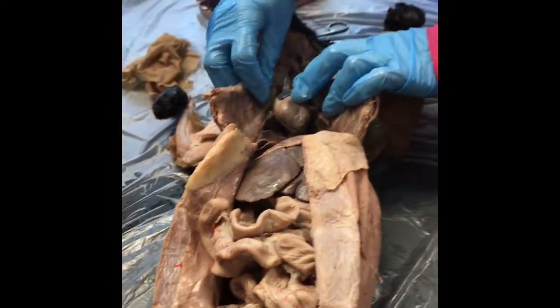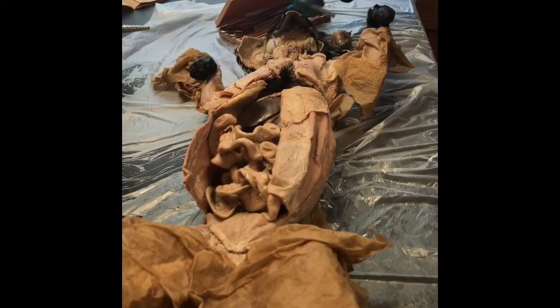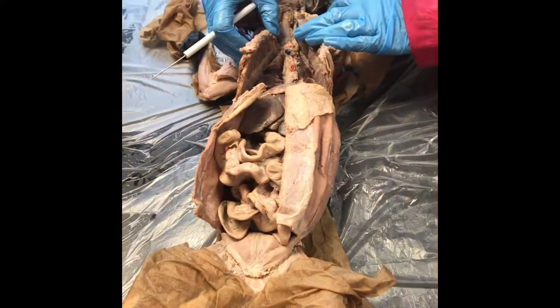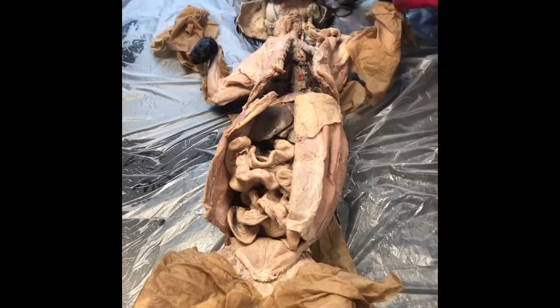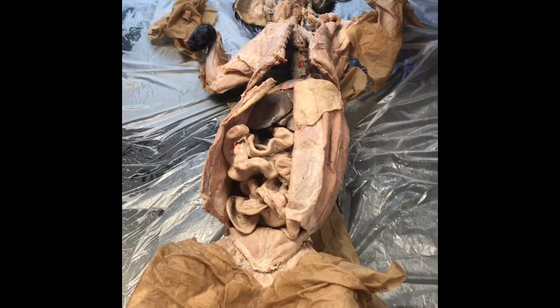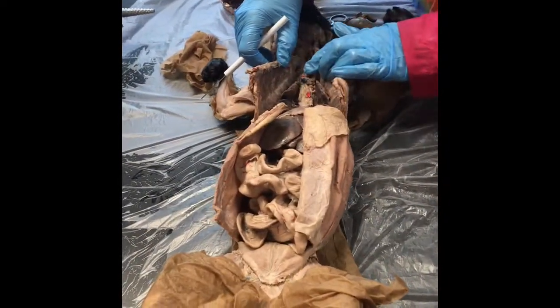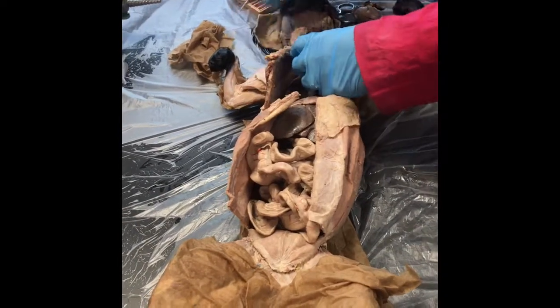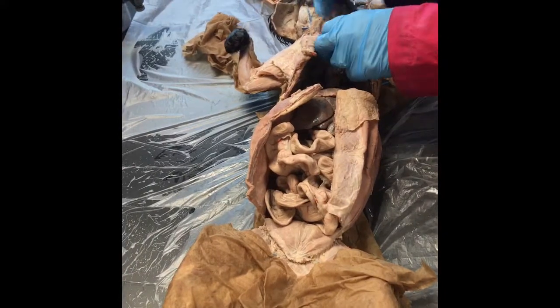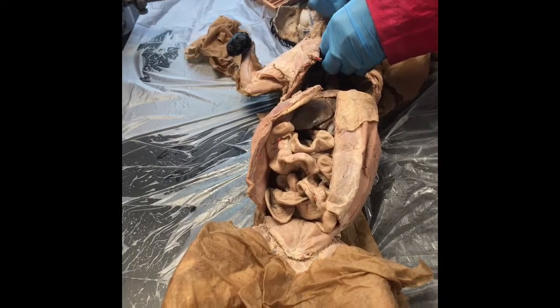Remember I said that there was this thymus gland that sat on top of the vessels. Now, let's talk vessels. Okay, so let's do veins first. So your superior vena cava, inferior vena cava really is going to be dealing with the heart itself because it's pretty much non-existent when I come up here, especially the superior vena cava. Okay, now, when we go from the superior vena cava, again, this is still thymus gland that we just didn't cut all the way off.